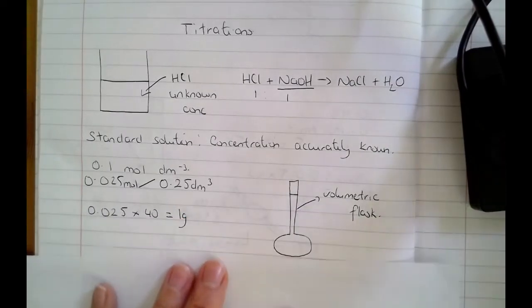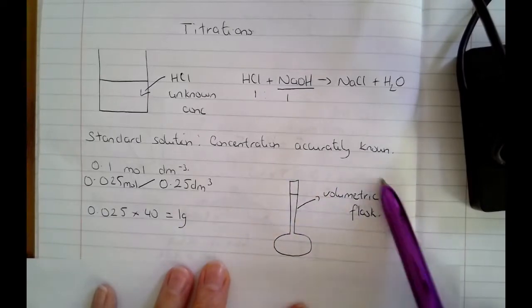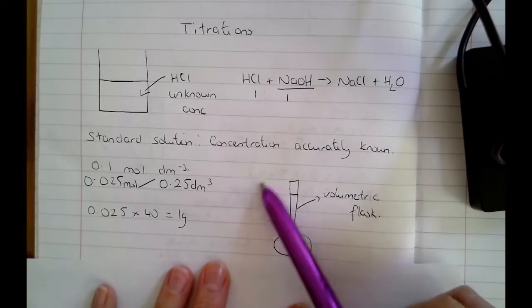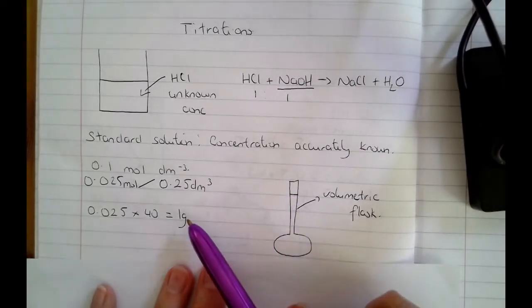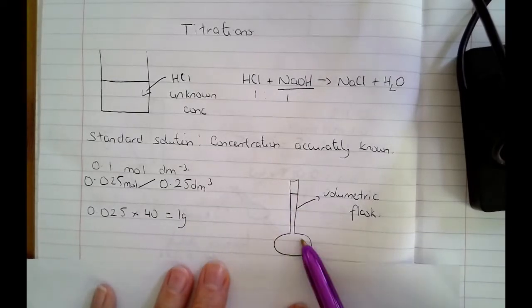And I weigh out my gram of sodium hydroxide, and then I transfer that gram to a volumetric flask. We always use volumetric flasks to make up standard solutions. They can ask you a few practical questions about how you would transfer the sodium hydroxide to make sure that all of it got transferred into the flask.